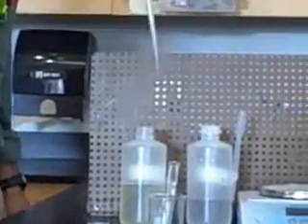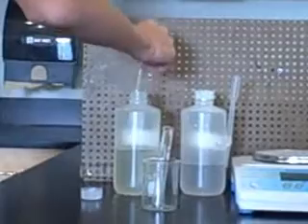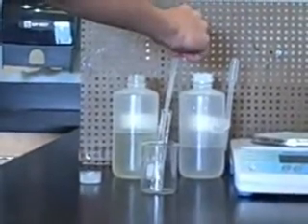It sucks up the liquid. Take it out, and then dispense it in the test tube. Great. Thank you.